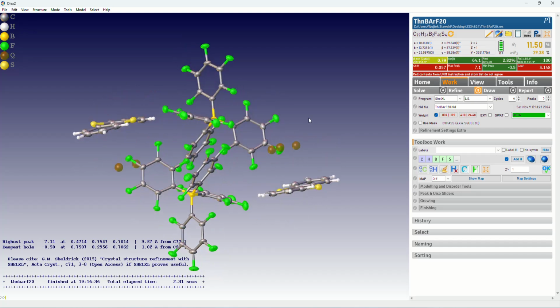So we can do solvent masking in two ways. Firstly, we can use BYPASS. It's very convenient to use from OLEX, it's the easiest way. We can also use PLATON. And PLATON works in a similar way. There's just a little bit more clicking, but we can do both ways. And I think, usually in my experience, it's worth trying both ways and then comparing the results and using the better one. So there were some structures where OLEX worked perfectly fine, but there were some cases where PLATON gave me better results, and also the other way around. So yeah, it's something to play with.